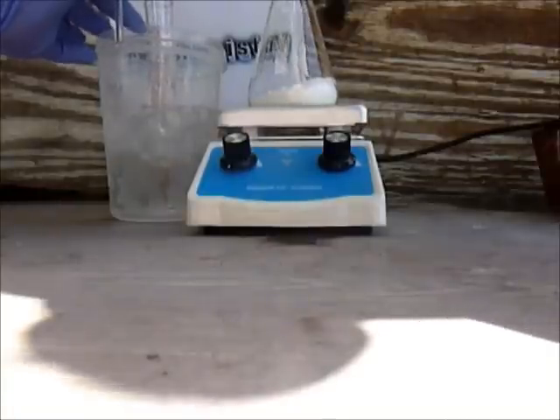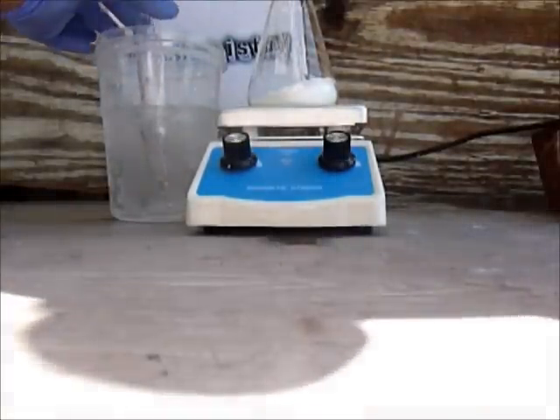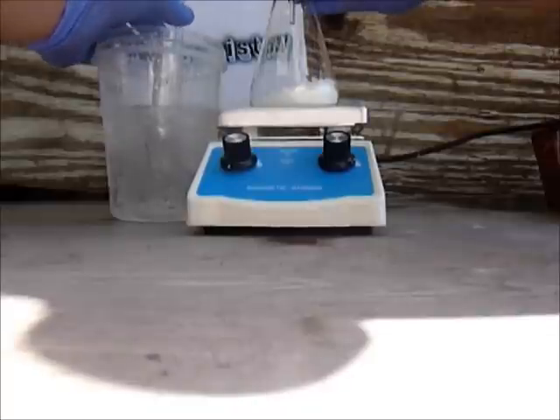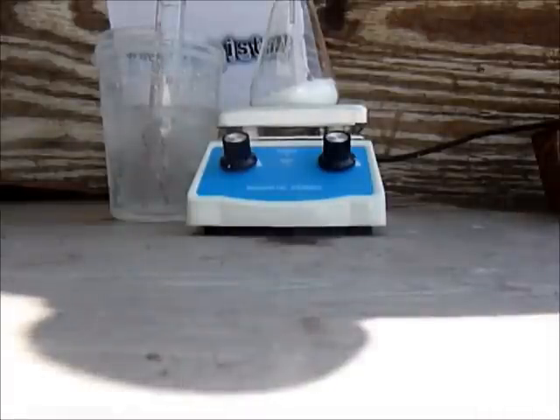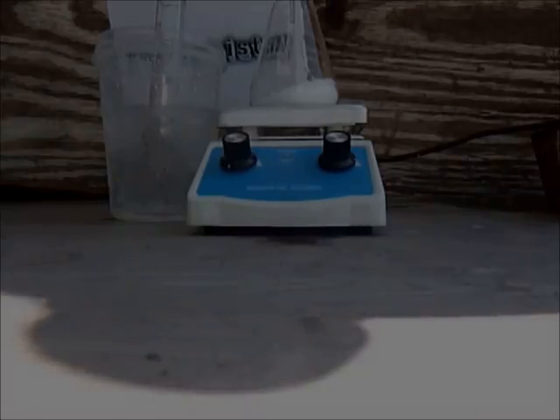Okay, that's about enough. Put the stopper there. Just wait until you see it starts bubbling — I'll show you when it's starting to bubble.